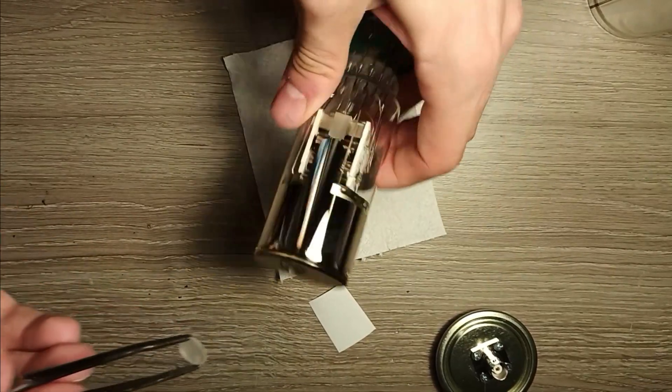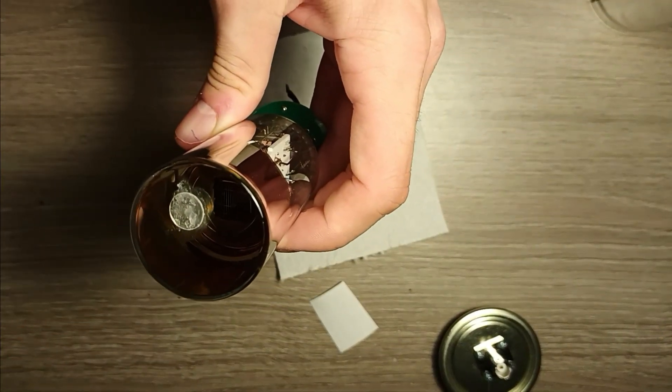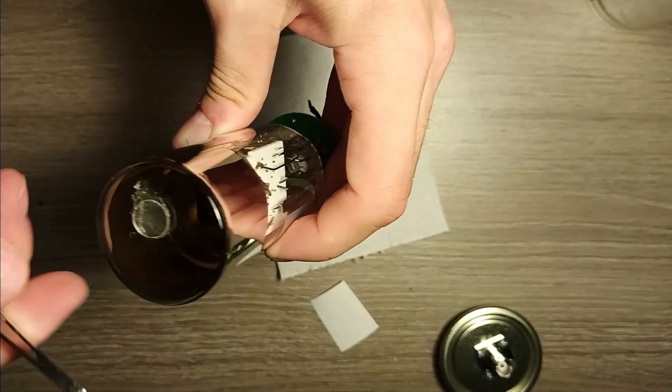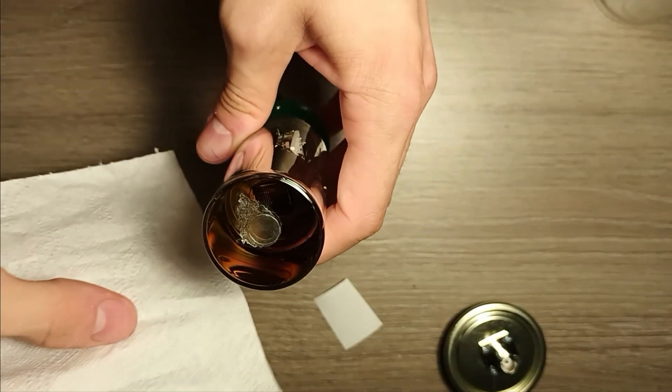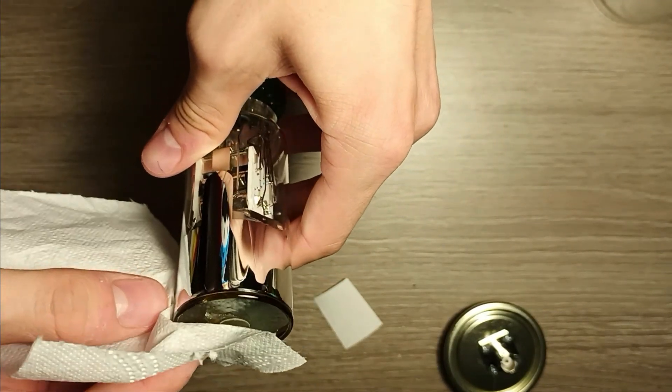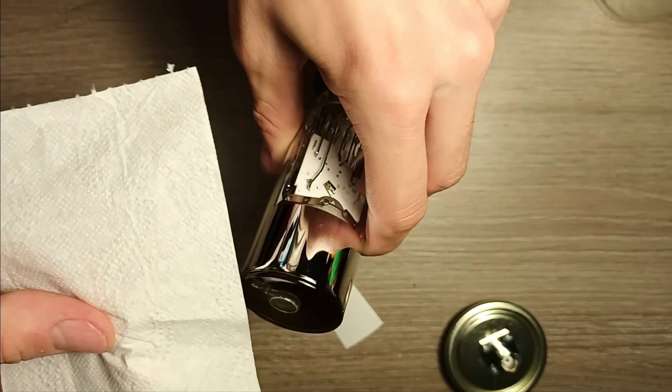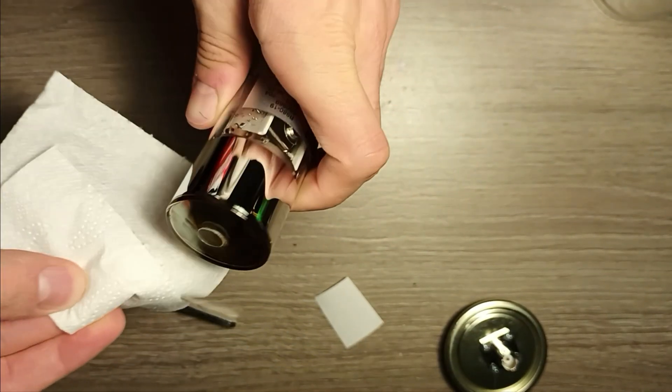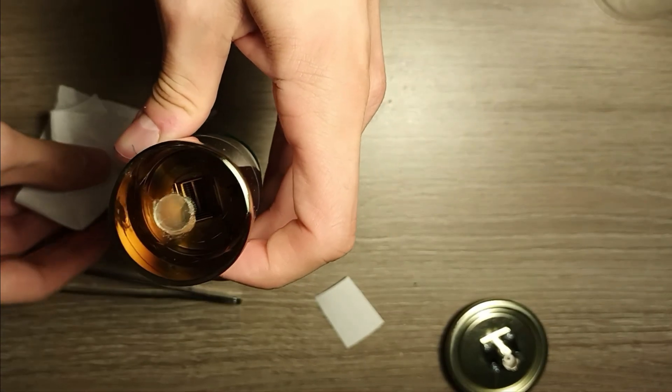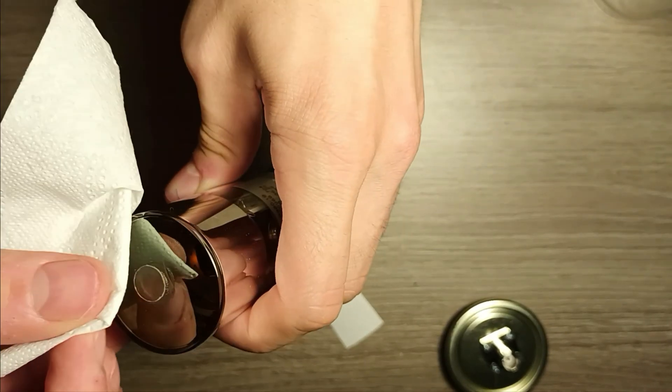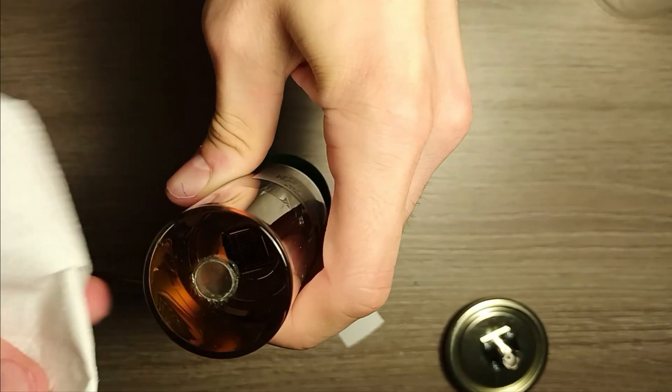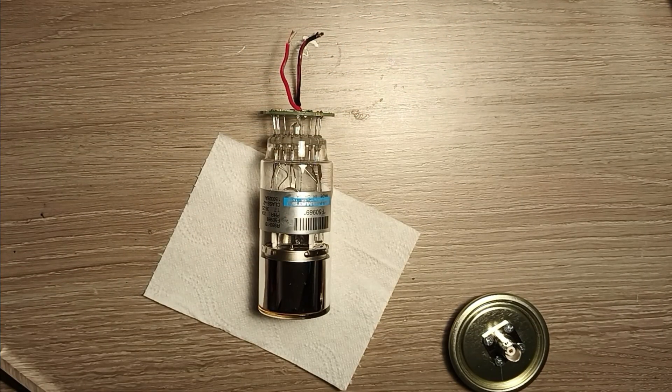This process ensures us to get the highest max possible resolution from the final spectrum. Another important aspect to achieve a high resolution is to never use a crystal that is larger than the face of the photomultiplier tube. So in this case you can clearly see that the diameter of the crystal is smaller than the diameter of the optical face of the photomultiplier.